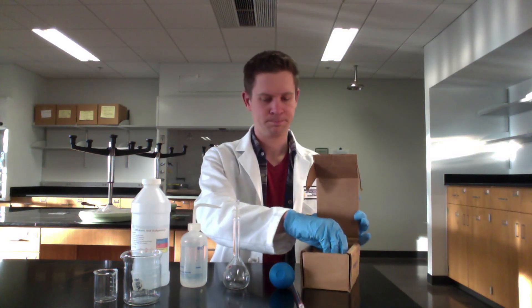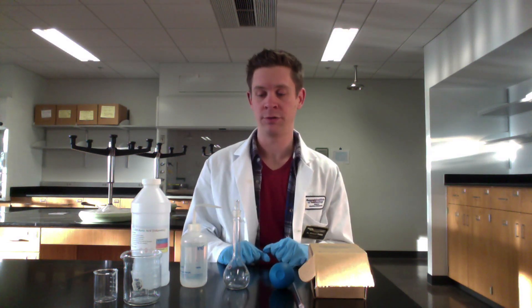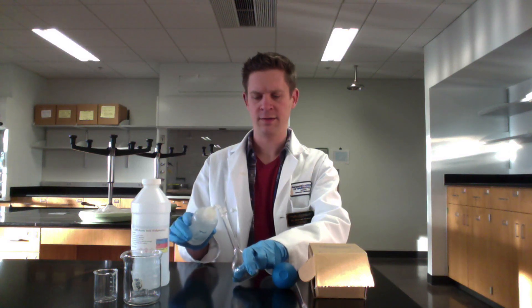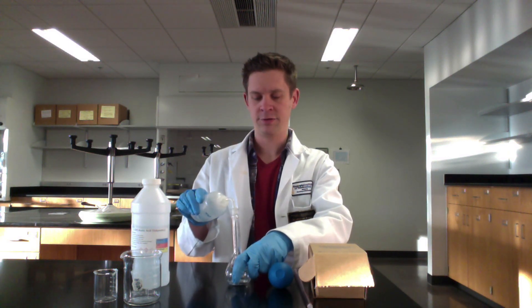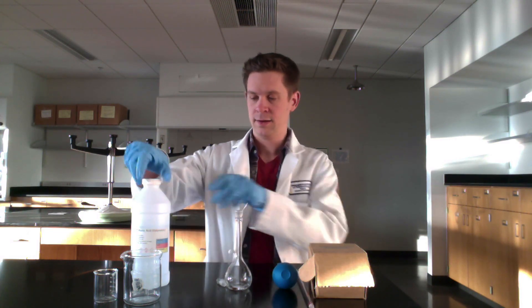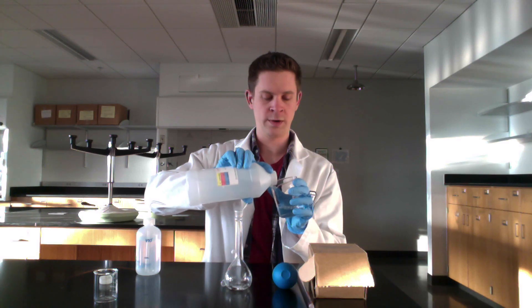The first step, once we know our stock and target volumes, is to measure out the amount of stock solution and place it in the volumetric flask. I'm going to add a little bit of distilled water to the flask initially, just to get some solvent in there. As long as we don't hit the mark, this is totally fine — when working with solids, it helps keep the solid at the bottom. Then open the stock, transfer it to the first beaker, cap the reagent bottle, and set it aside.